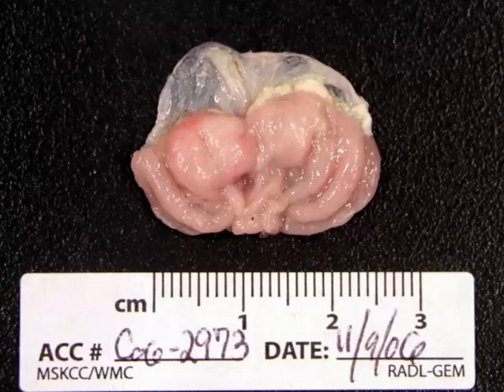In knockouts and transgenics, you can make just about any type of pathology you want in a transgenic. So I don't like working with transgenic mice. I'm still trying to get my head around all of the magical things that happen spontaneously in nature, and then we go and change the rules and knock in a gene or knock out a gene, and then all the rules change. And then occasionally you can see it associated with colitis, and in mice that are housed in large numbers together, or densely housed mice. So this is a nonspecific finding that can be due to a large number of potential causes, or you often will never find out the cause.